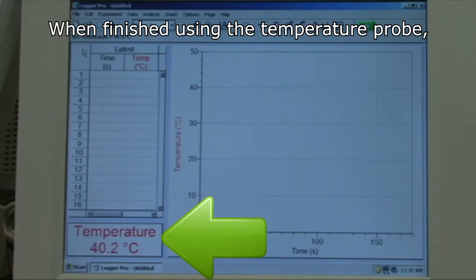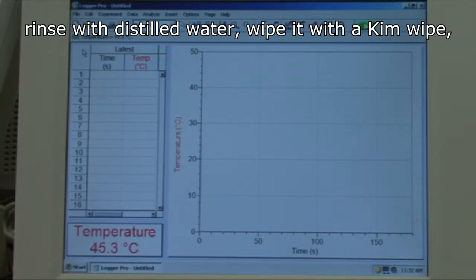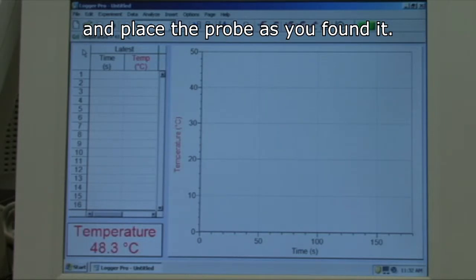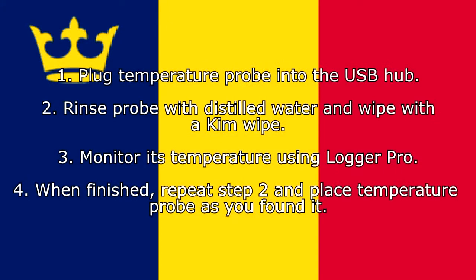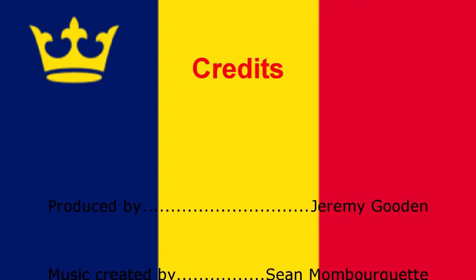When finished using the temperature probe, rinse with distilled water, wipe it with a Kimwipe, and place the probe as you found it.